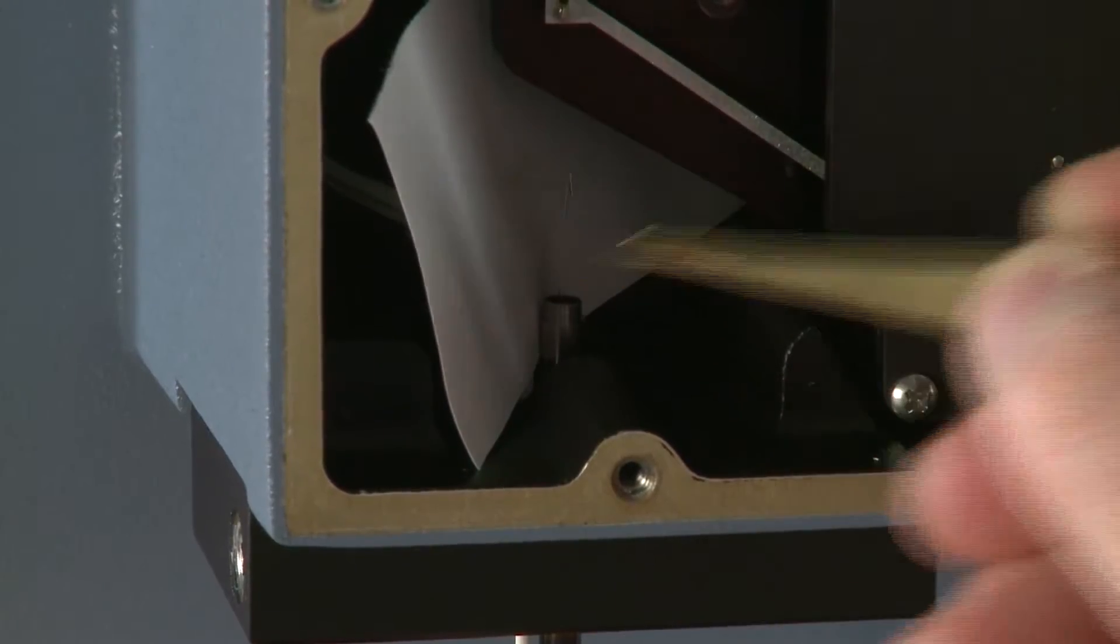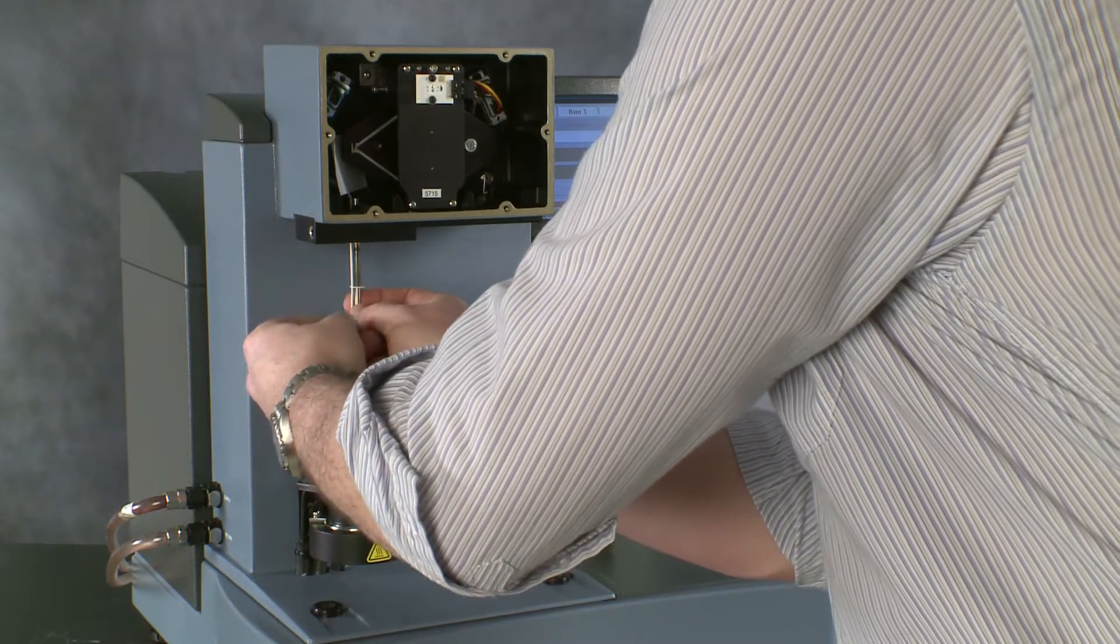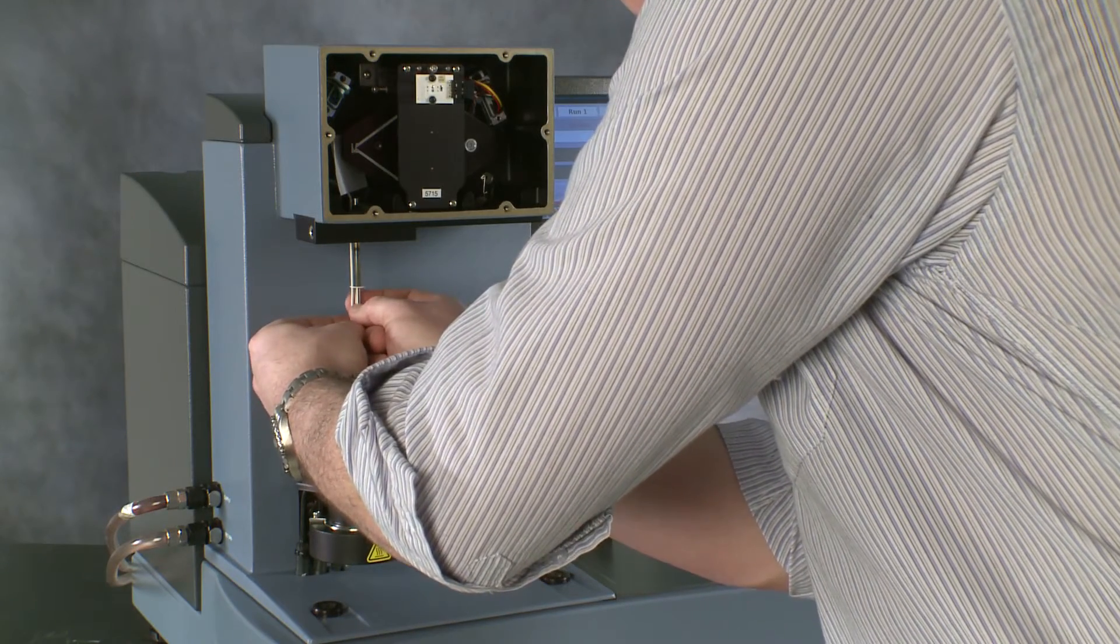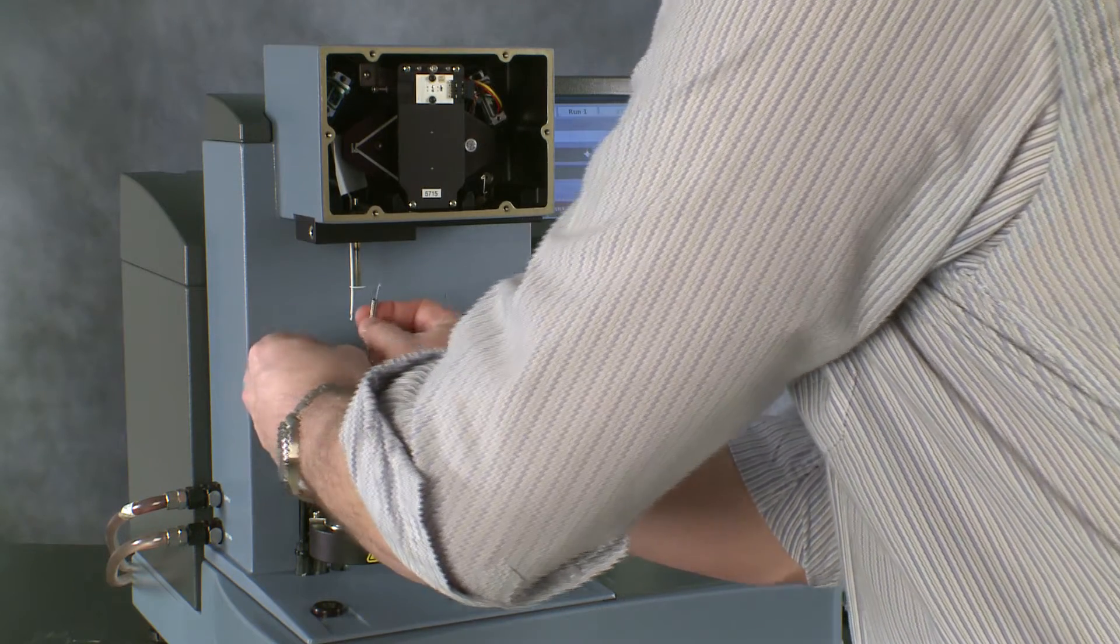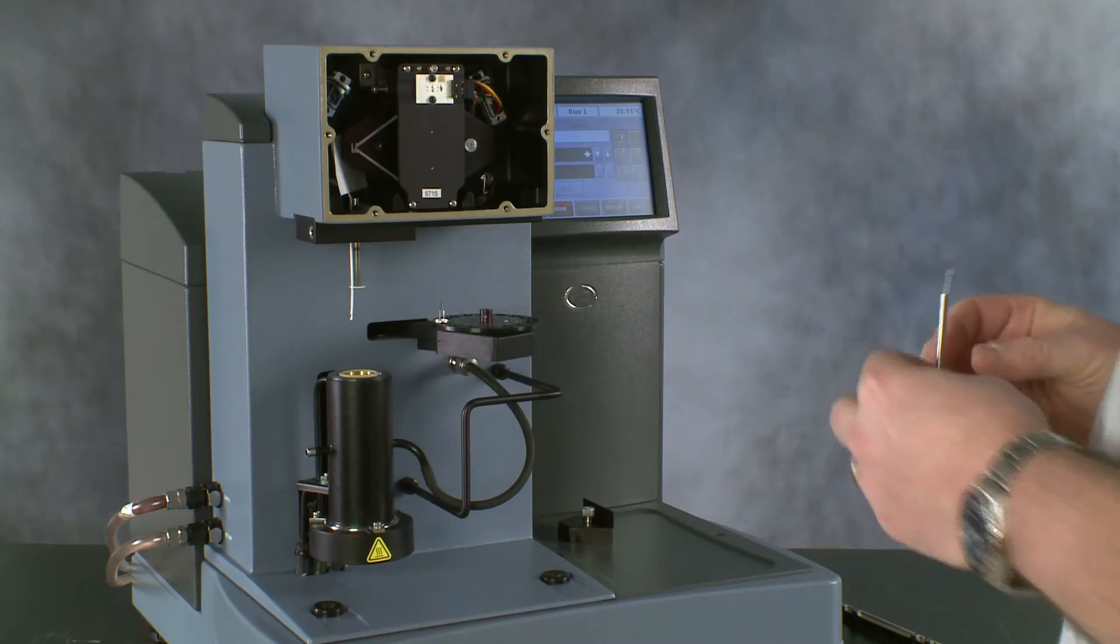So, now we've got it free from the coupling loop, we can lower our changing tube and take the old hang down wire out.